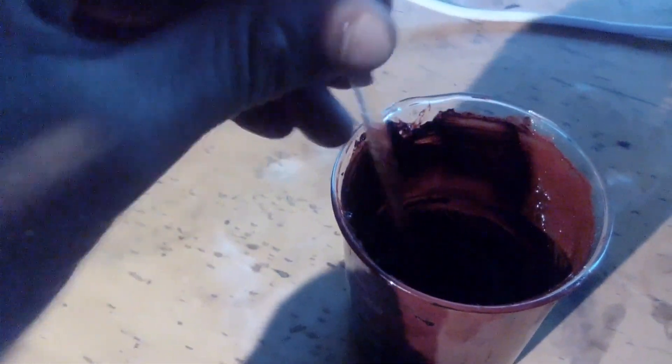This is the mass after the slow cooling. As you can see it's quite red, and now we are going to wash it with water to clean up the insoluble dye.